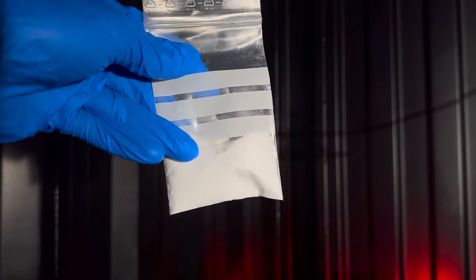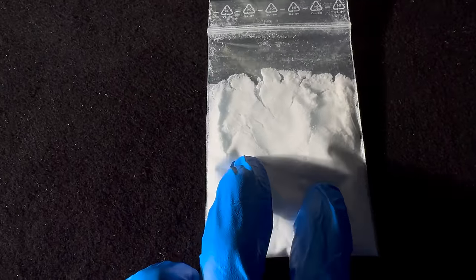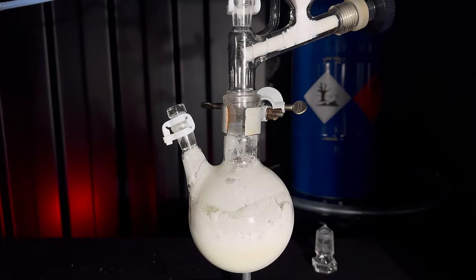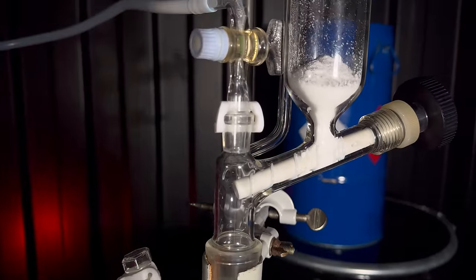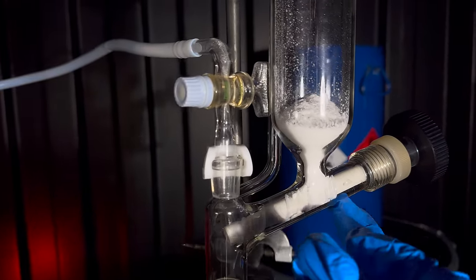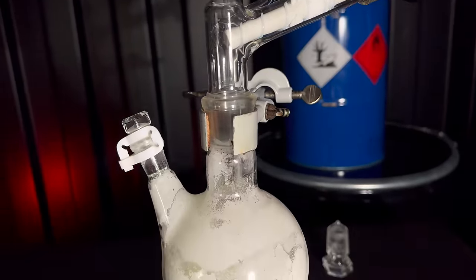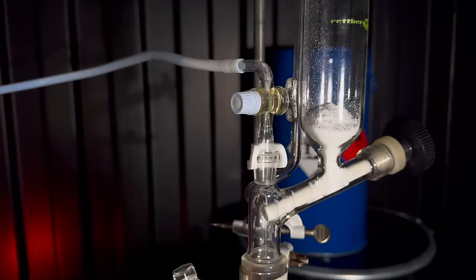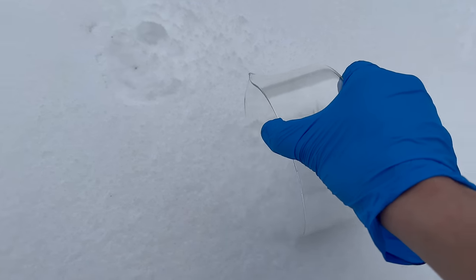The PCl5 will be used as it is and I am going to use 18g of oxalic acid. I made sure that it's really fine. I filled oxalic acid into a very special piece of laboratory equipment that I've never used before myself. This is a powder addition funnel. You can see that it has this spiral thing and if you turn the knob, you can slowly push the powder into the apparatus. This reaction is going to produce HCl. Another sodium hydroxide gas trap is advisable.